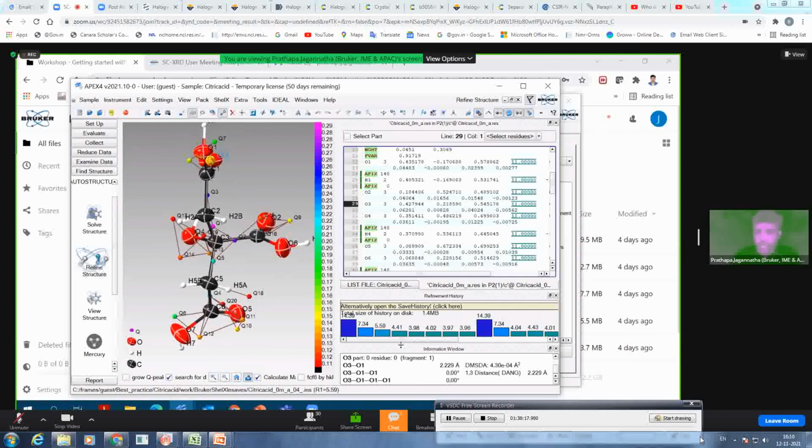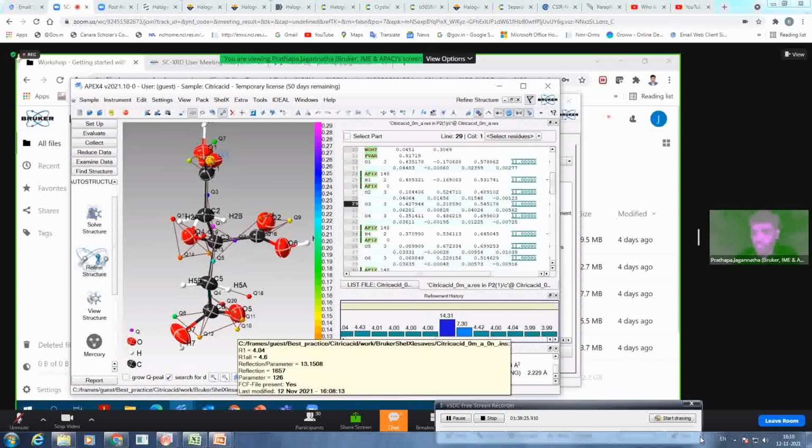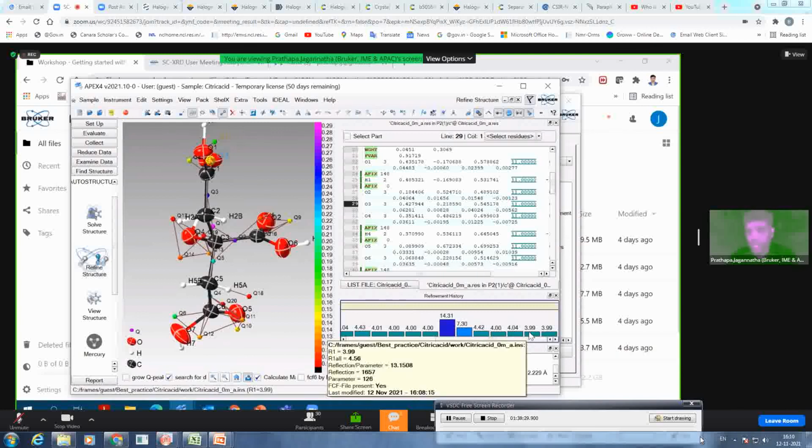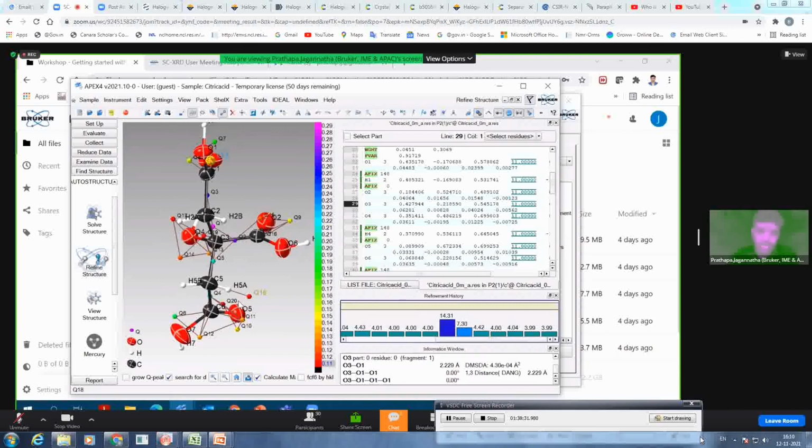And then the important point is you also get this refinement history, so it will always remain with you. You can close your laptop and come back the next day or a few days later, and you might have done some 100 cycles, so you can start from any cycle. So if you made a mistake in the 50th cycle, you can come back and start from the 50th cycle, because it remembers everything and stores everything.